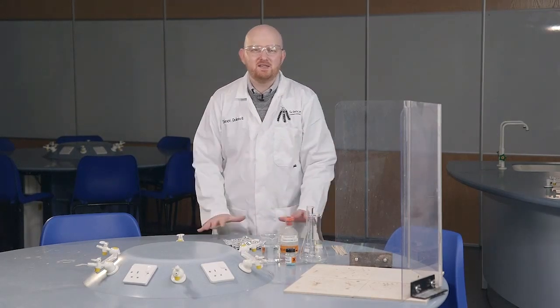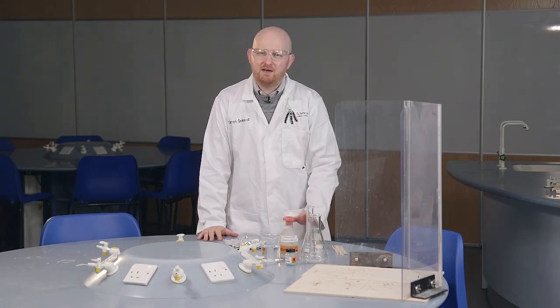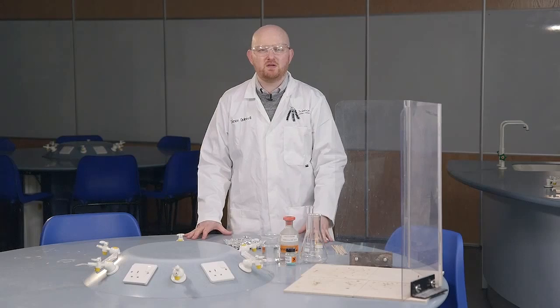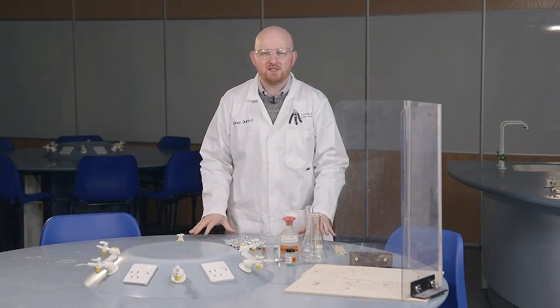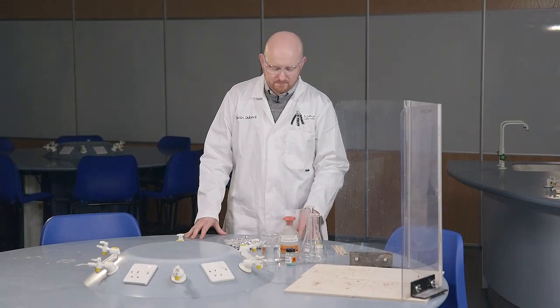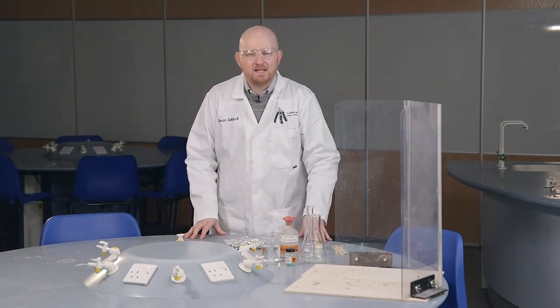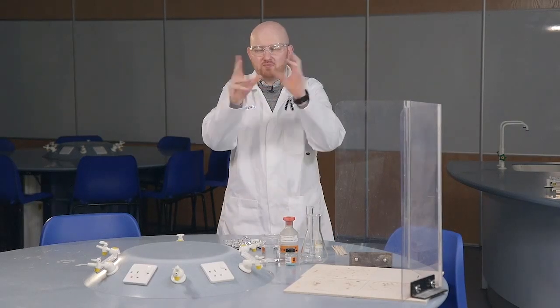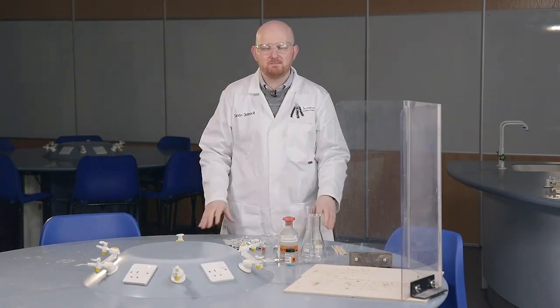This is our second chemistry demonstration in our Christmas theme. Our Christmas theme is Santa Claus is coming to town, and our first demonstration was the endothermic reaction, which set the scene, which got ourselves cold, our ice forming. Our second demonstration is called the Northern Lights, a really nice displacement reaction using copper and aluminium, and creates basically the Northern Lights in a conical flask. So we'll get some nice green wispy flames.